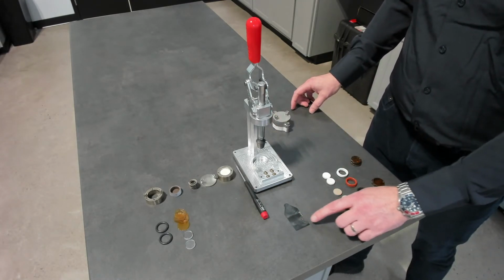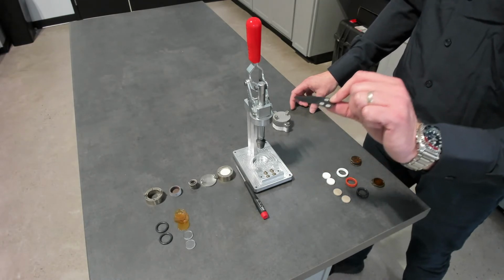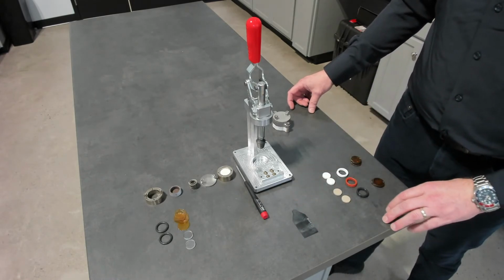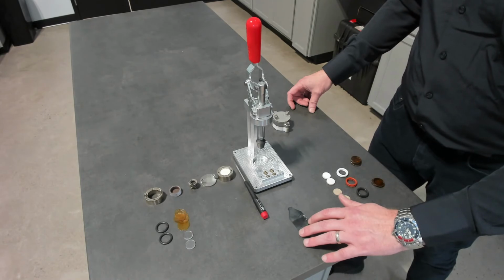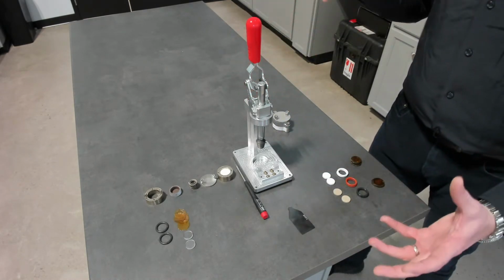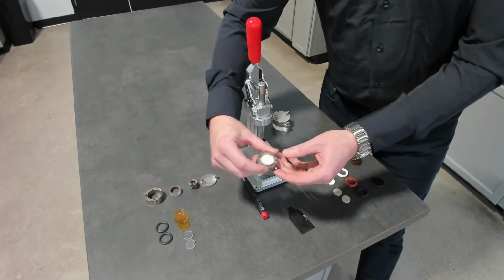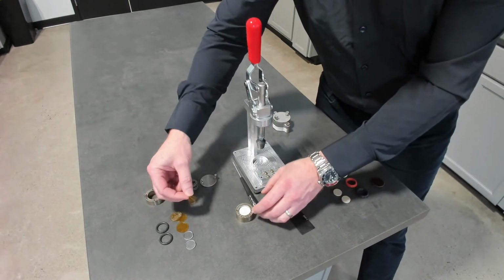So we're going to use our TPS sensor. This is 3.2 millimeters radius. You could also use one more size, which is 2 millimeters radius. The model on that is 21171. And this is our stand that we'll use to kind of pull it all together. So this is our bottom portion. What we're going to do is introduce a layer of Kapton.